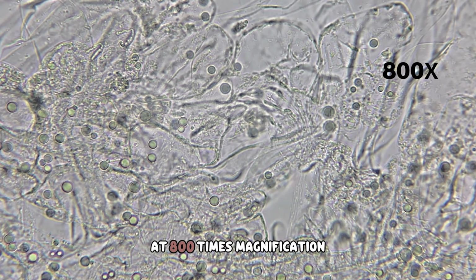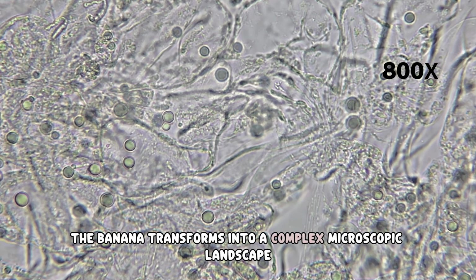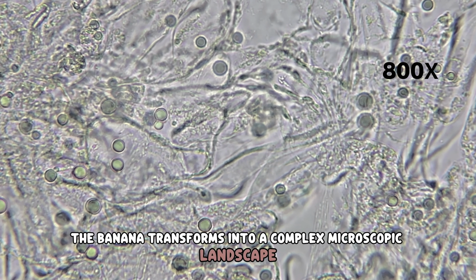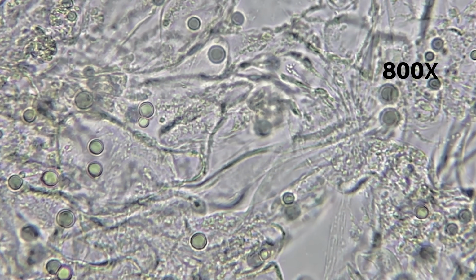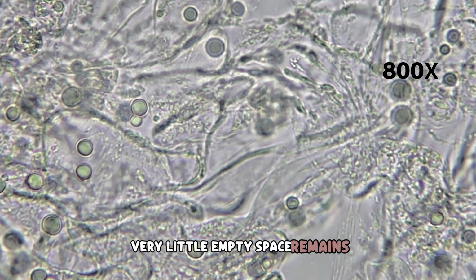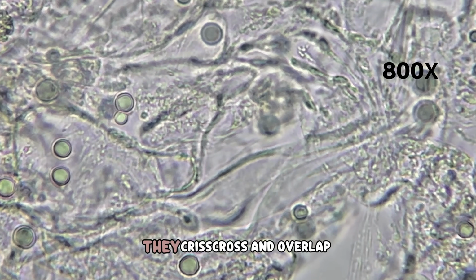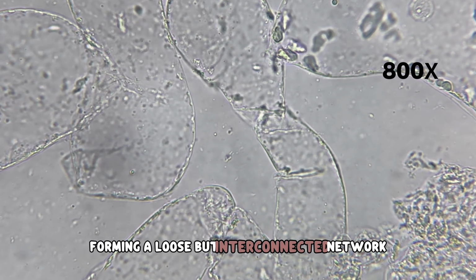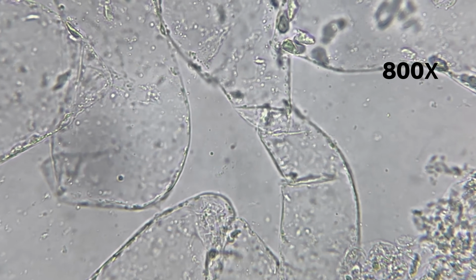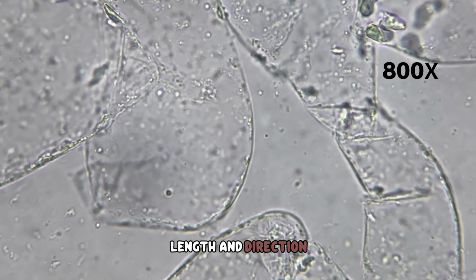At 800 times magnification, the banana transforms into a complex microscopic landscape. The field of view becomes dense with detail. Very little empty space remains. Fibrous structures now dominate the image. They crisscross and overlap, forming a loose but interconnected network. These fibers vary in thickness, length, and direction.